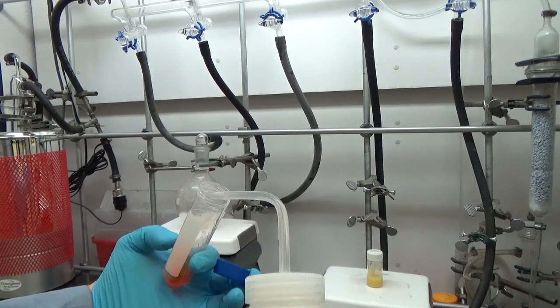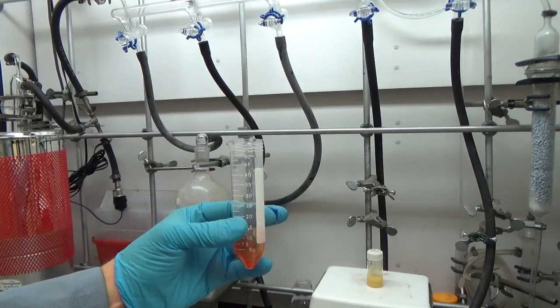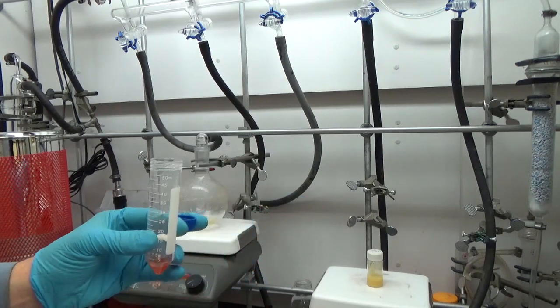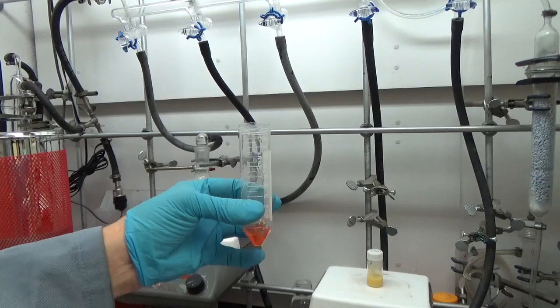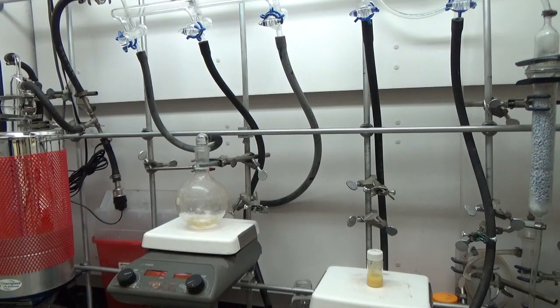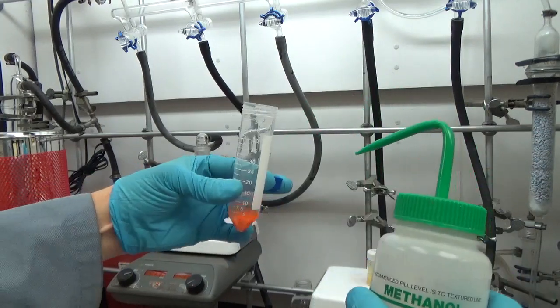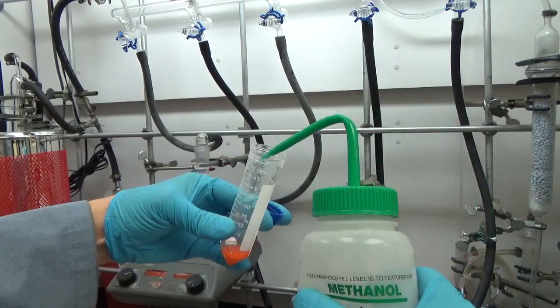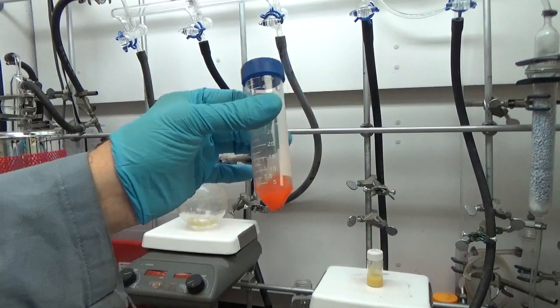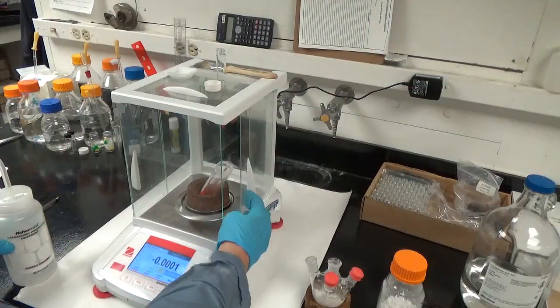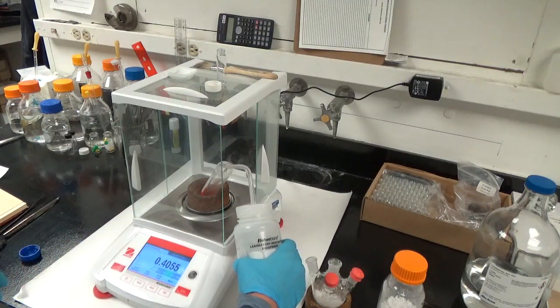We decant the liquid. We're going to precipitate them one more time. You don't have to do this and it's a little dangerous because if you precipitate them too many times they'll lose too many surface ligands. If that happens it's probably best to start over. You have to just know your own materials well enough to know how many times you can precipitate them. Note that I did not add that much hexane - maybe just less than five mils. That's because it helps to precipitate the dots if they're concentrated; they kind of find each other a little bit easier in the precipitation process.